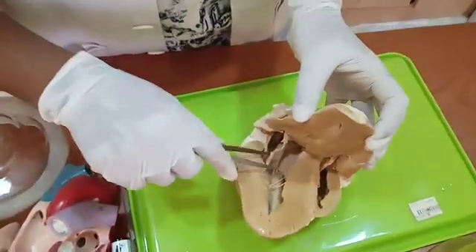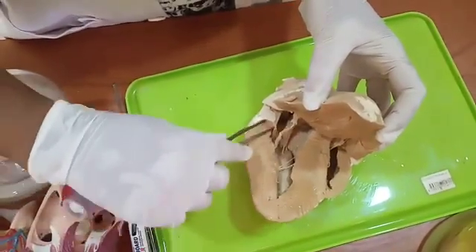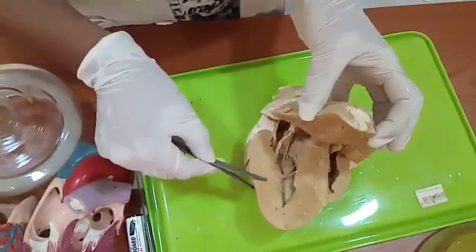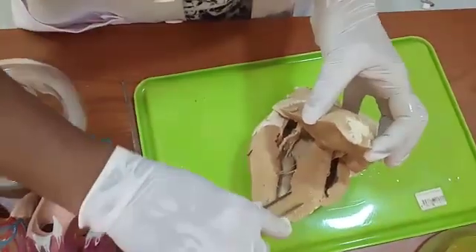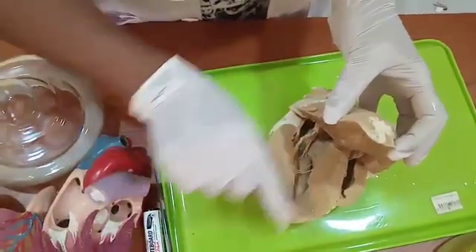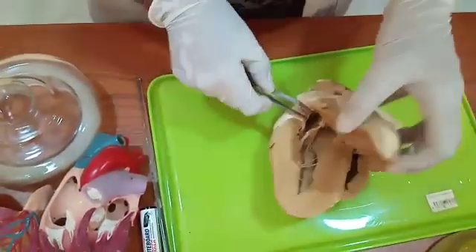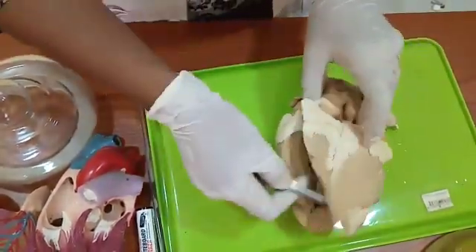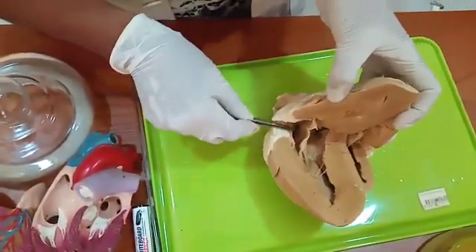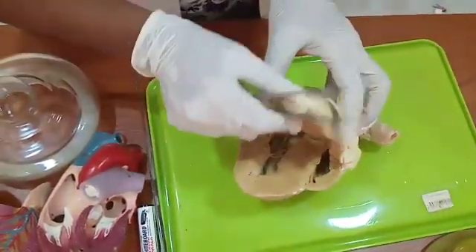You can clearly see these thread-like things — these are the valves. Some valves are damaged, so you can't see them clearly. You can actually see the muscles — the cardiac muscles. These white things are the fat. The atriums are very small and the walls of the atriums are very thin, as you can see.